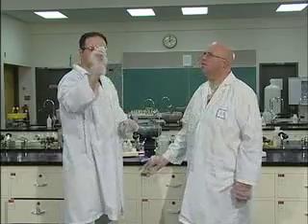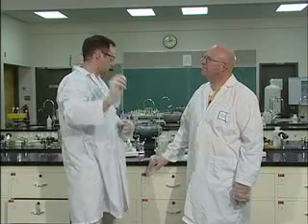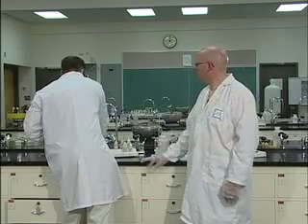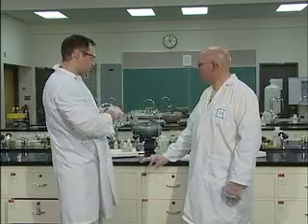Okay, and again, we don't get much happening to our litmus paper. So it's an acidic solution. Do we get to do the litmus test on all of them? I believe most of them. So that would be the end of your part A.